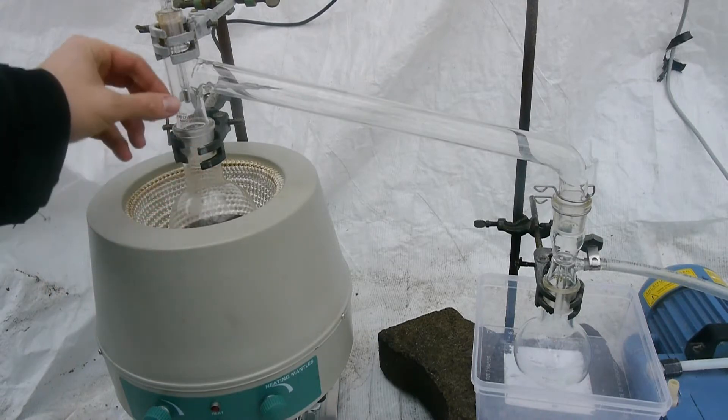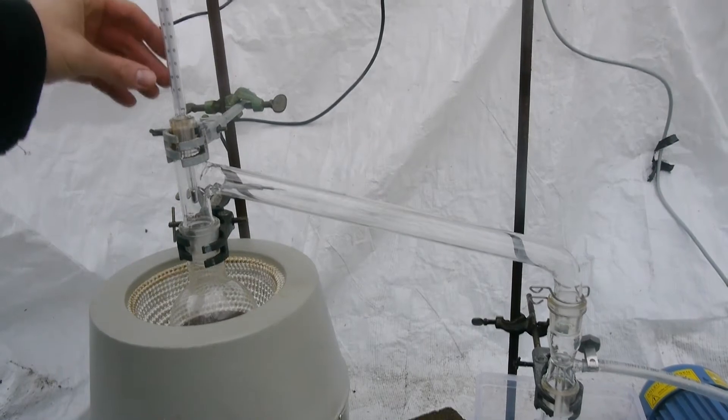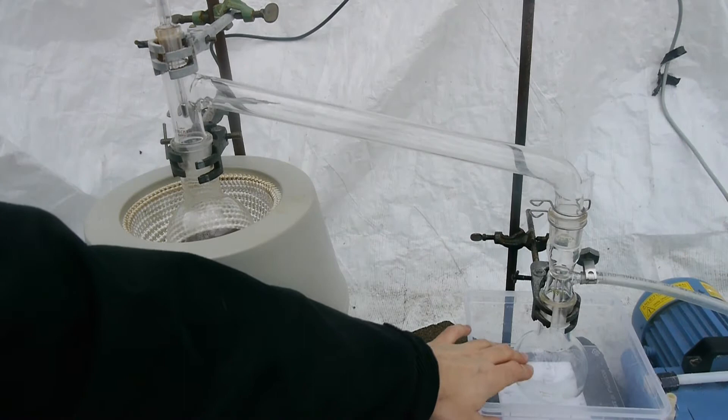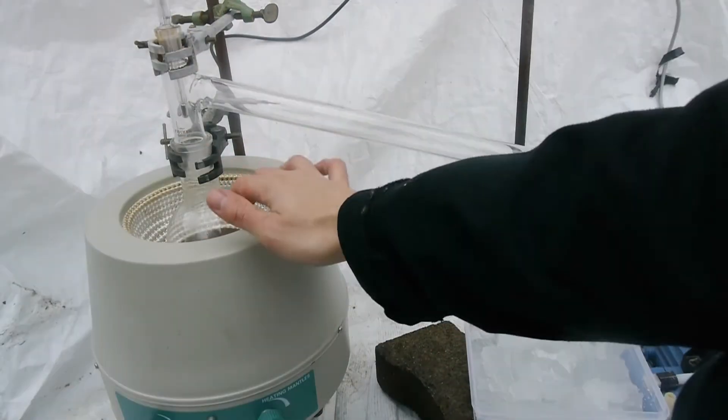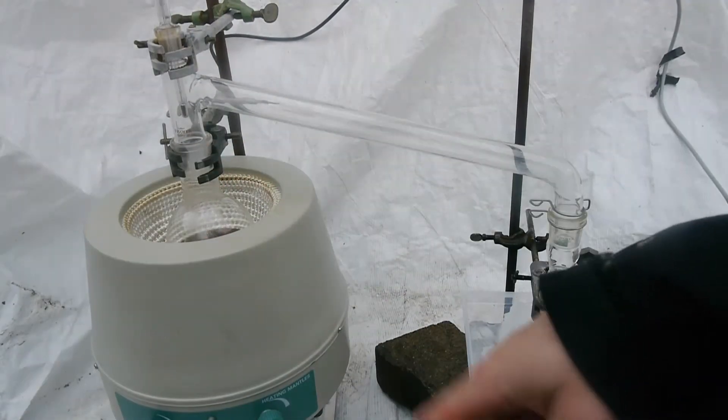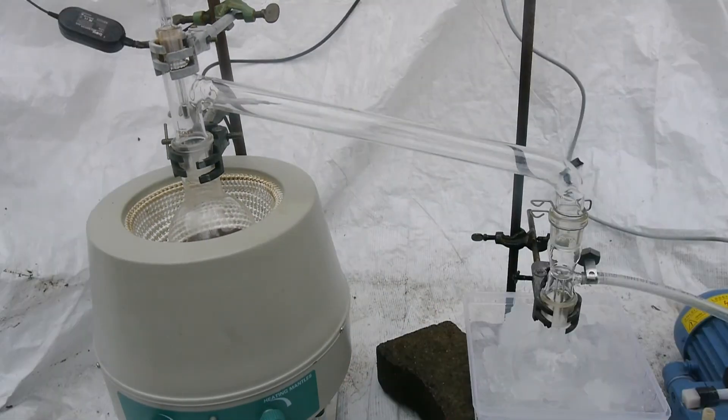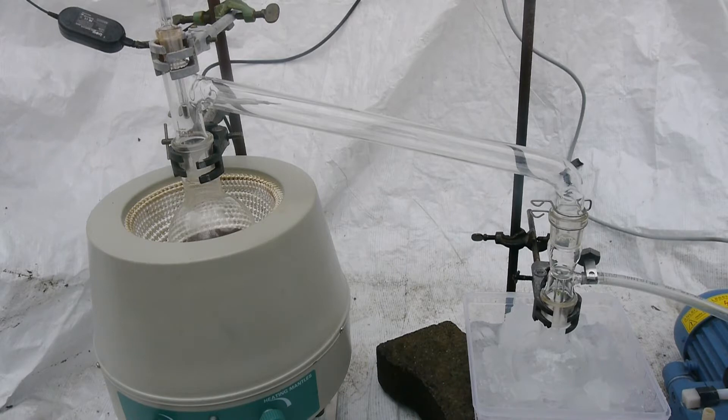Here we have our mercury. This can distill over. This thermometer where I can read the boiling point. Over this air condenser into this flask that I will cool with ice. Adding a stir bar to the mercury would be quite pointless because it would just swim on top and wouldn't actually help. Let's start by evacuating the system and hope that it's vacuum-tight.